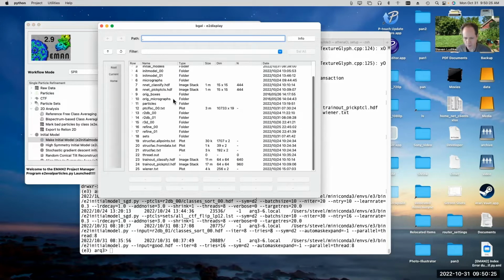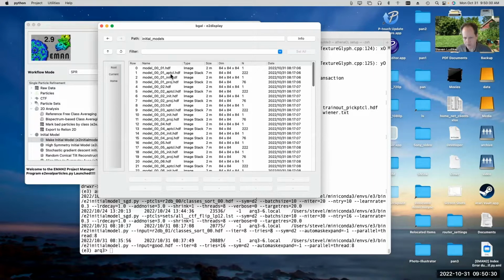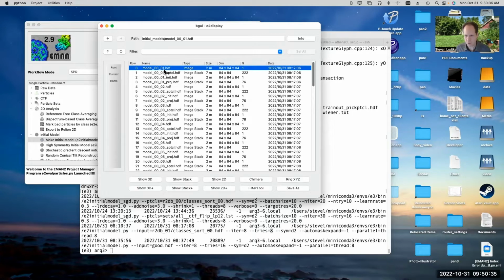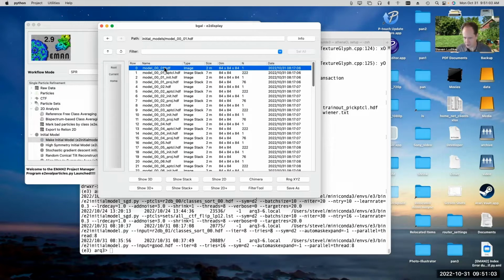Gotcha. All right, so let's look at what we got. So initial models. There are 4 different types of files that the initial model generator produces. This is the actual 3D map. This is the initial model that you would use if you decide it's good. This, where it says init, is what it started with when it used its randomly generated refinement process. This is not something that you should ever use. I know it's got init in the name. That's the init for the initial model generation. This is the output of the initial model generation.